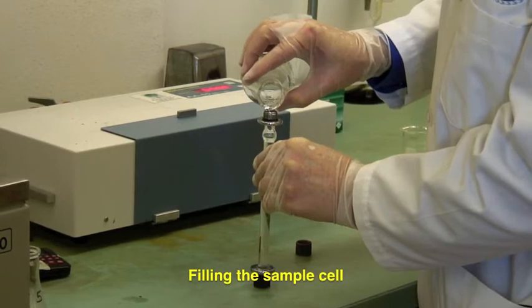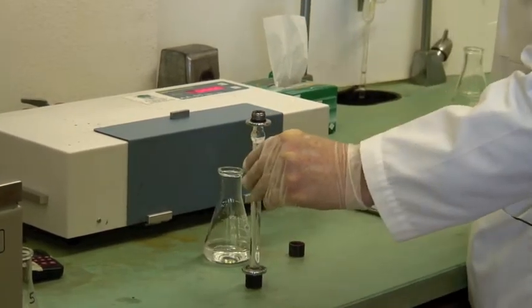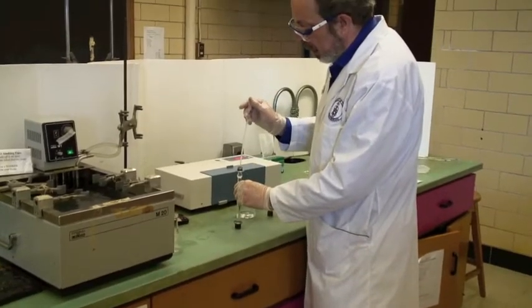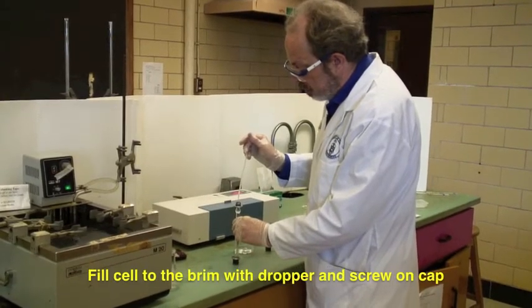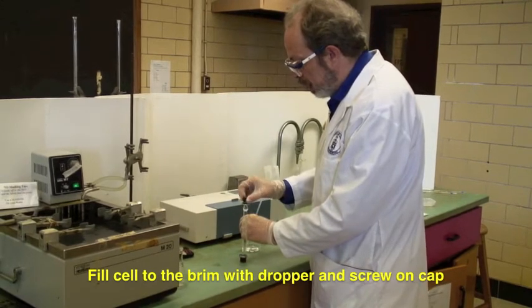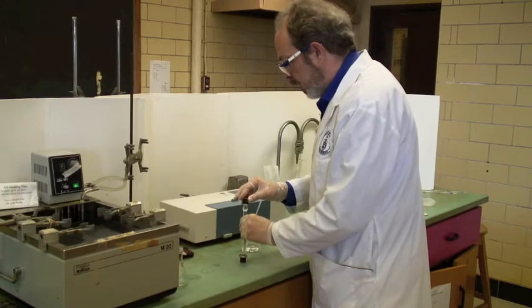It's almost getting there. I'm now to the stage I want to use a dropper. So taking a dropper and adding up. You want to fill it so that it's somewhat brimming there. The idea is to get a minimum amount of air in here. And close that down.